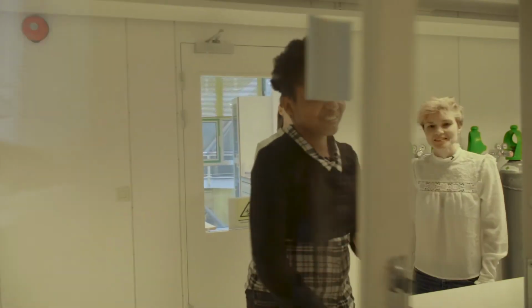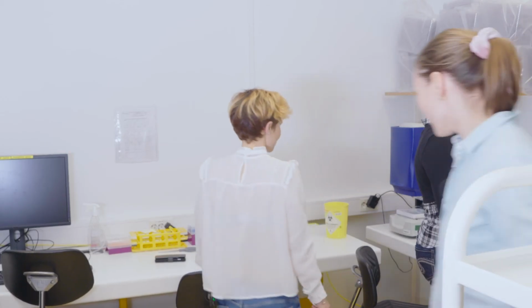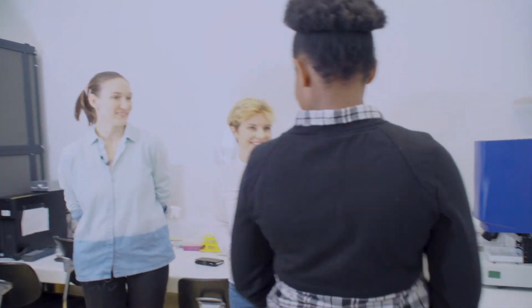One of the assays the Esguerra lab uses to study neurological disorders is the analysis of swimming behaviour, and Nancy is going to show us a machine called the Zebrabox that allows these types of experiments. Wow, it's hot. Yes, welcome to the zebrafish behavior room. As you exclaimed, it's really hot in here because the temperature is a constant 27 degrees.